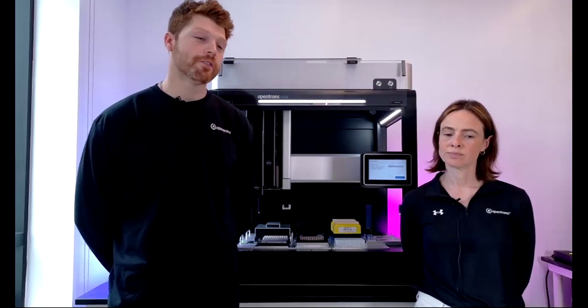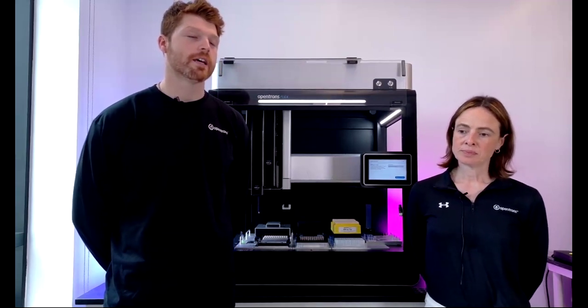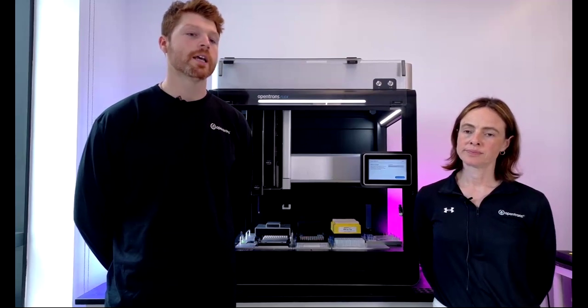Great. Enrique asks, can you comment on liquid sensing strategy? E.g., if pressure or optical sensors can detect when liquids get in touch with the tip, so to precisely estimate the volume of the well. Again, very relevant. So we actually do have pressure sensors in the current Flex pipettes.